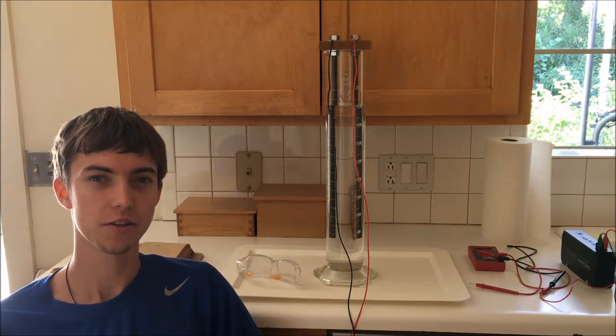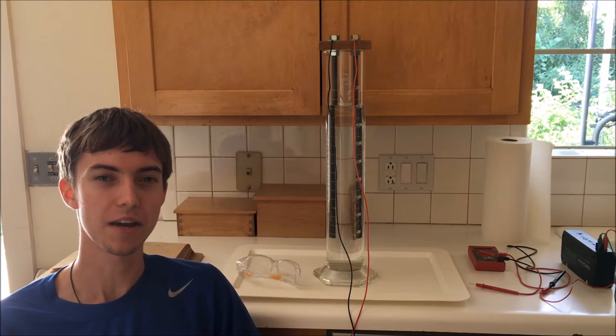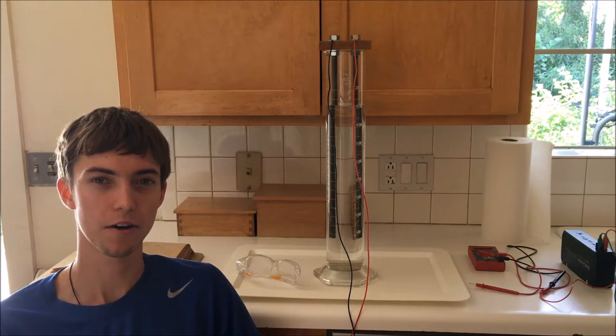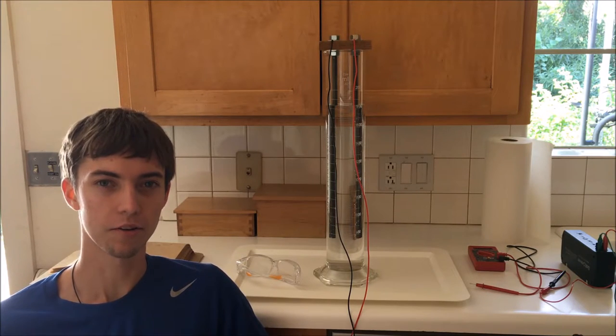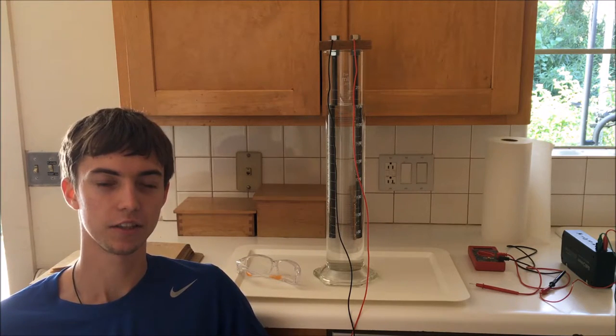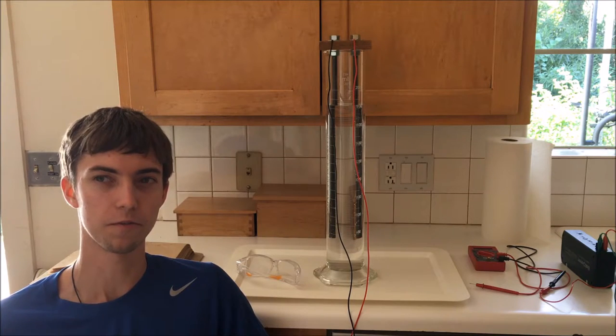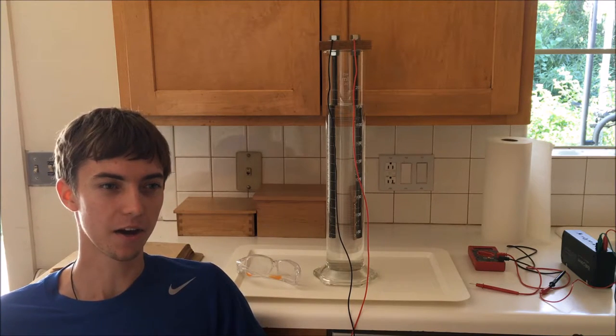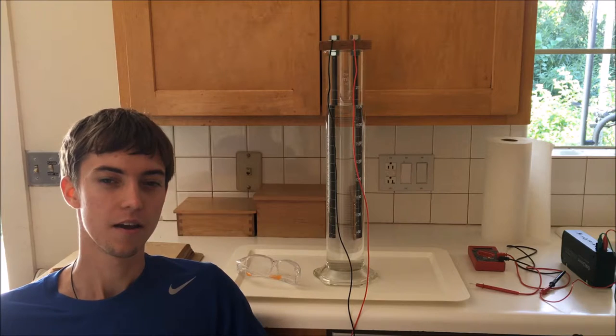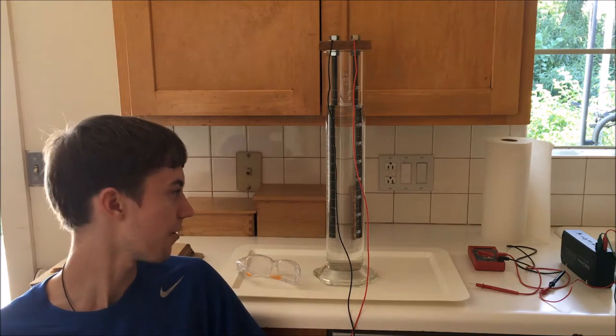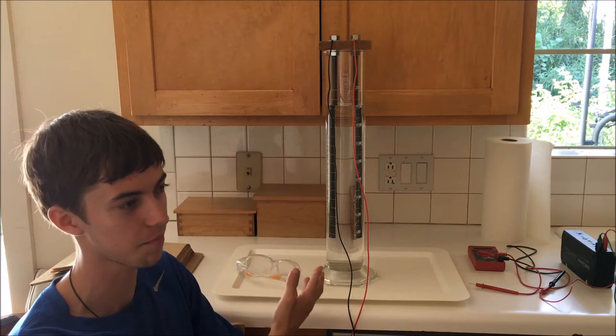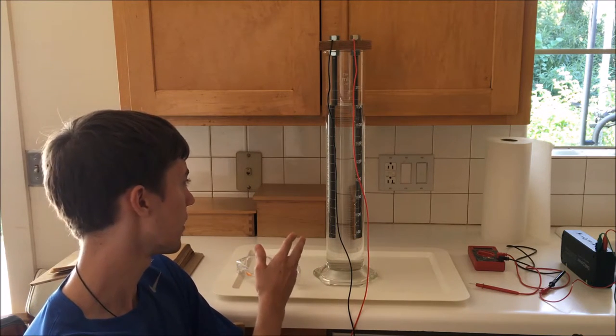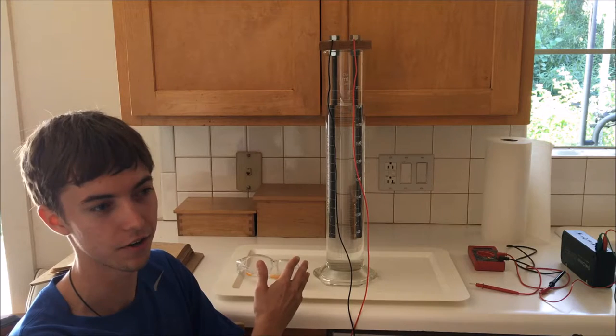There's a lot of cool things you can do with deuterium. Besides making ice that sinks in a glass of water, you can also produce a low-energy output nuclear fusion reaction in a device called a Farnsworth fusion reactor. I'm not going to be doing that experiment today. What I am going to be doing is showing you guys how I'm going to set up my first attempt at an electrolytic separator for rarefying and concentrating down deuterium in water.